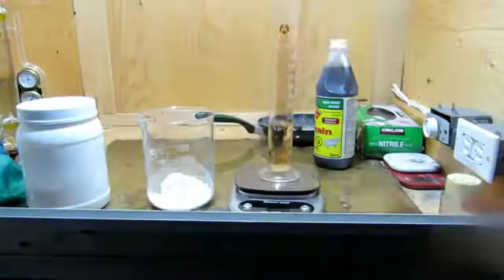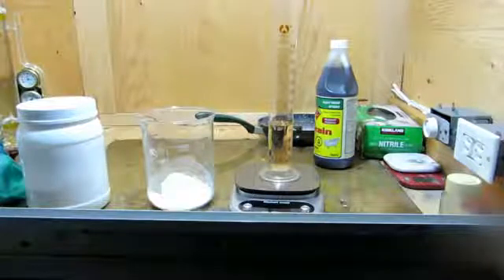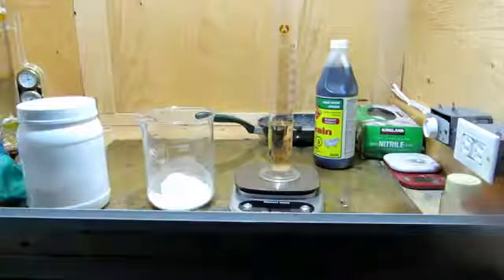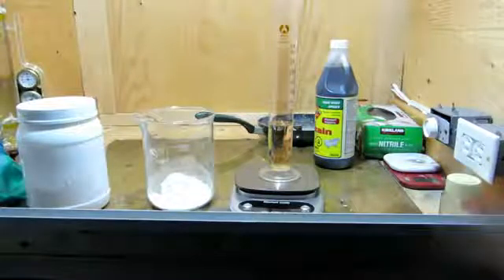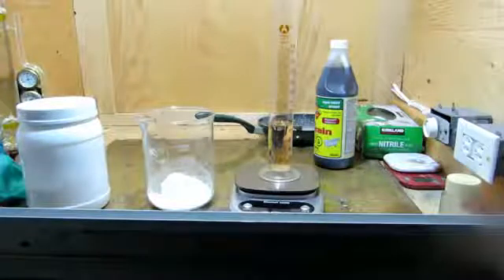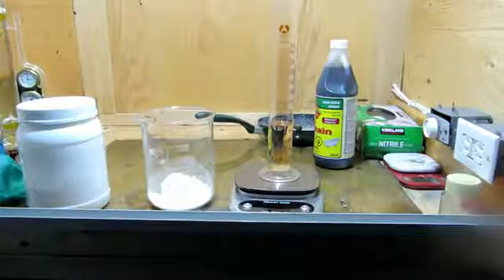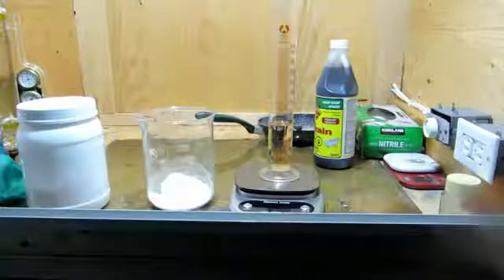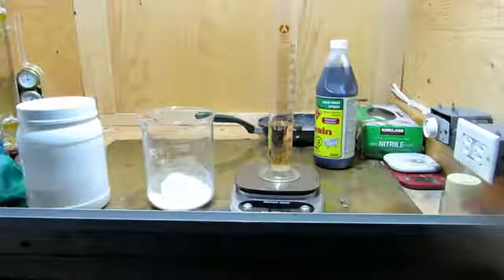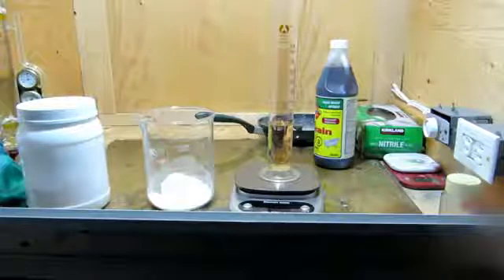The phosphoric acid produced should ideally stay in the water solution. So, we'll probably also add an extra 5 grams of calcium phosphate, and this will just ensure that all the sulfuric acid reacts, so we only have phosphoric acid left in the solution. And because calcium phosphate is insoluble in water, any unreacted calcium phosphate can be filtered off, and then we should be left with a decently pure solution of phosphoric acid.